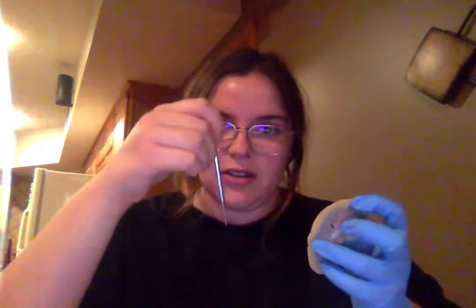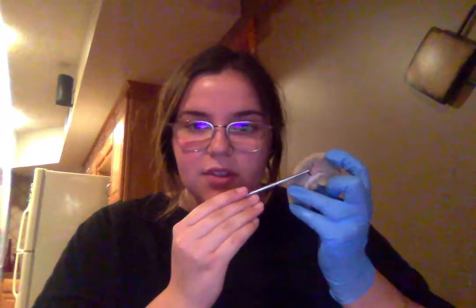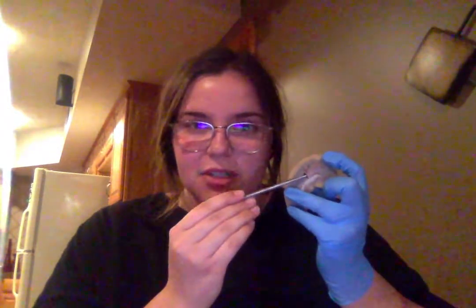So then the minor calyces, which again were a little bit difficult for me to identify until I pulled back on the kidney like this. They're a little bit difficult to show because I can't really get into there with both hands doing this and showing it, but at the end of each of the renal pyramids, there's that minor calyx. So it'd be behind here a little bit deeper to that.